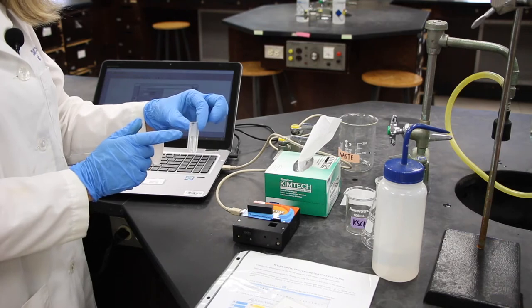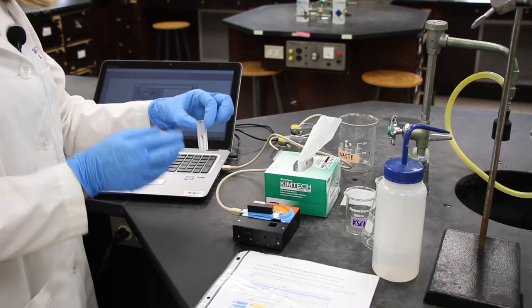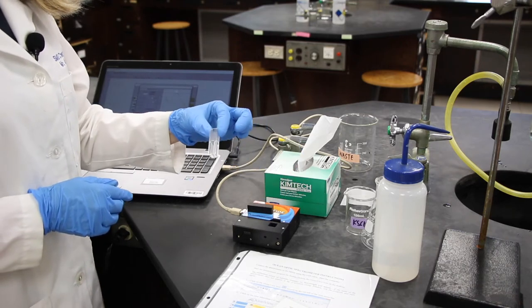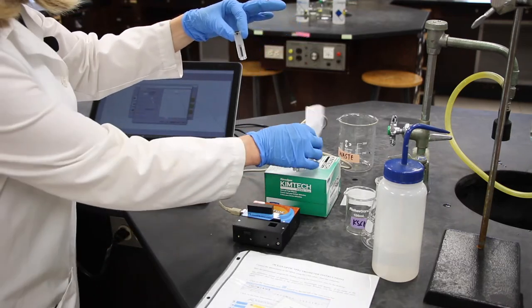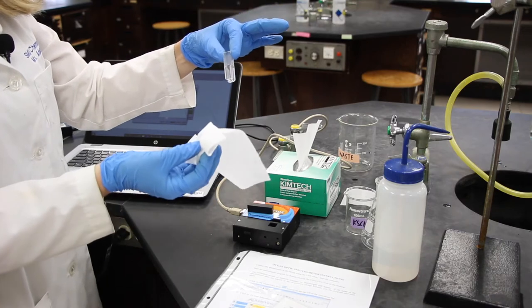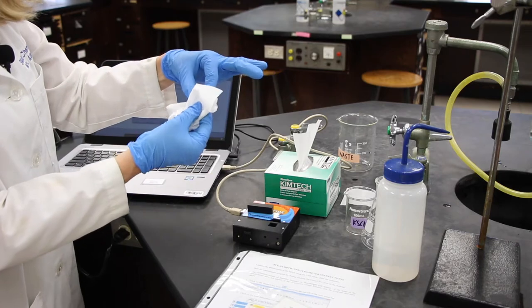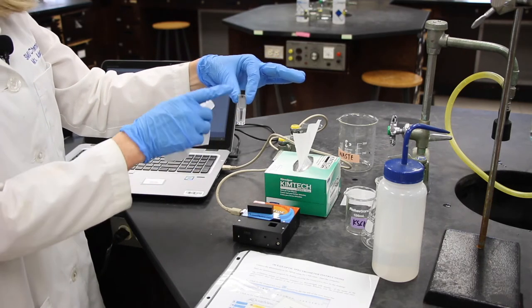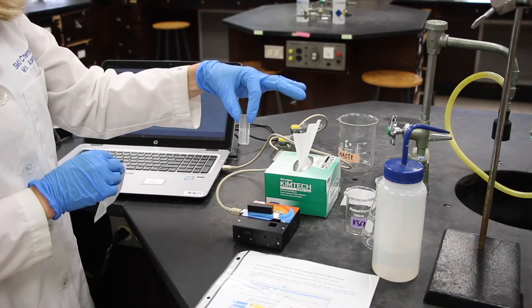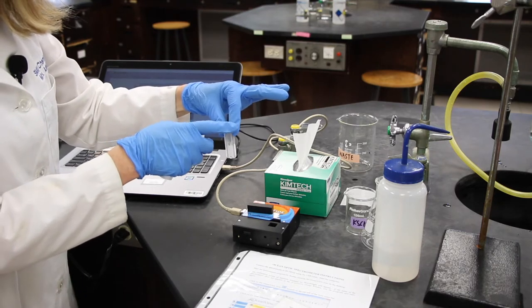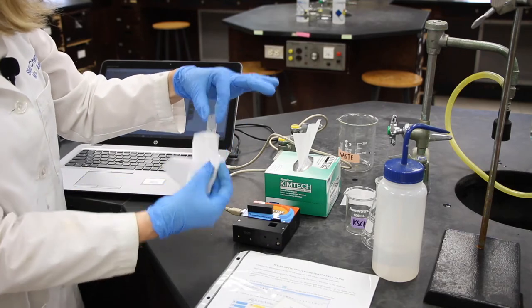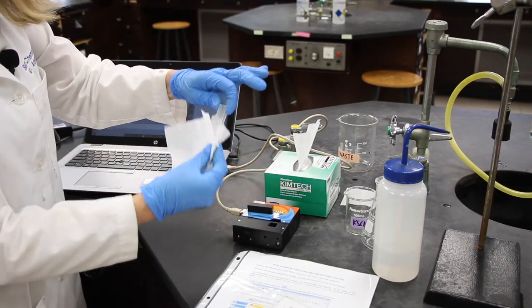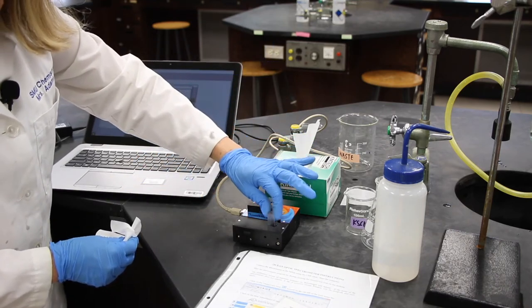So always use the same cuvette. You'll also have to normalize your cuvette before every time that you put a new sample in. And normalizing, you just fill it up, put it to waste, and then fill it up again before you insert it in your spectrometer. You'll also have to be sure that you wipe the cuvette with a Kim wipe, lint-free pieces of paper. And be sure you wipe it off before you put it in the cuvette. You're wiping off any fingerprints, any liquid that might have gotten on the outside of the cuvette. And then you'll also want to only hold this by the very top of the cuvette like this. Be sure that you don't wipe it off and then handle it and put it in there. Only wipe it off, holding at the top, and then you can put it in and be sure you firmly press down.